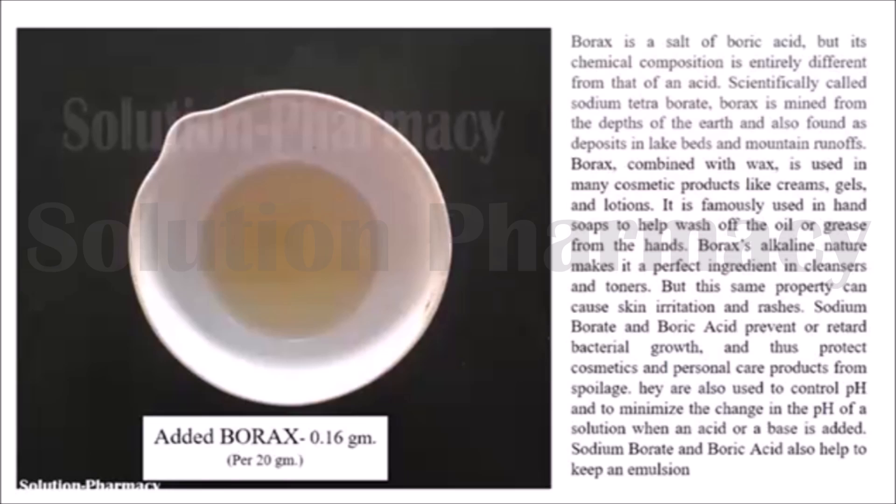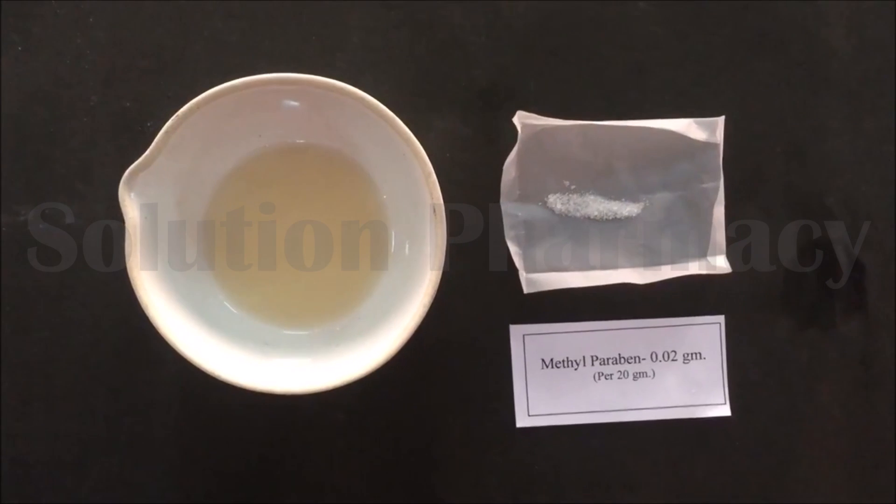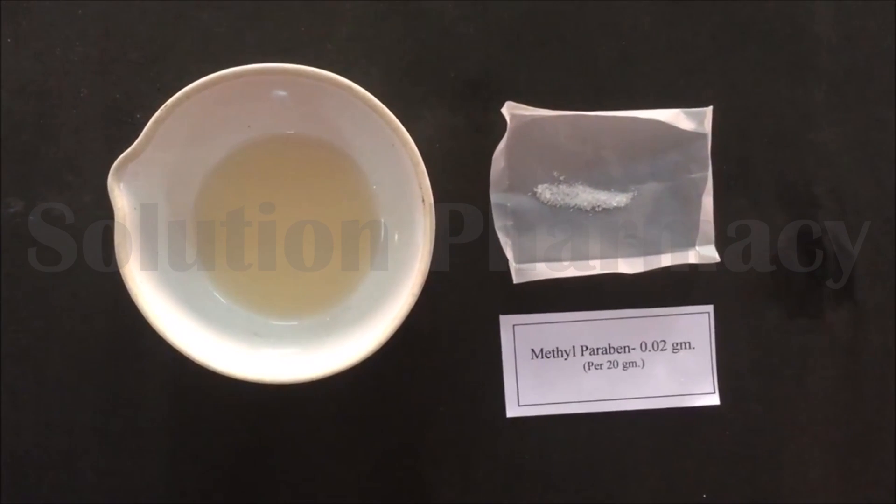Other than acting as an emulsifying agent, borax also prevents the growth of bacteria and maintains the pH of our preparation. Sodium borate and boric acid prevent or retard bacterial growth and thus protect the cosmetic and personal care products from spoilage. It is also used to control the pH and to minimize changes in pH when an acid or a base is added — meaning it is used to maintain the pH of our preparation.